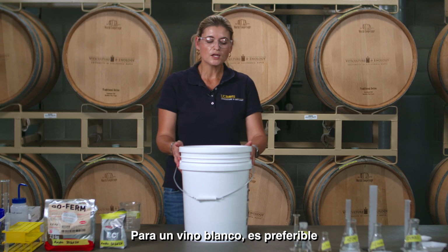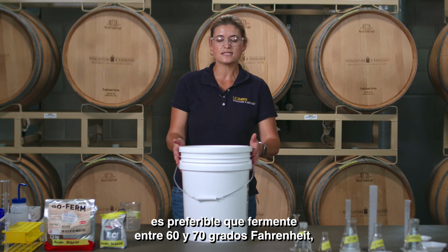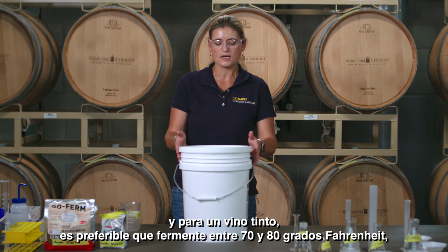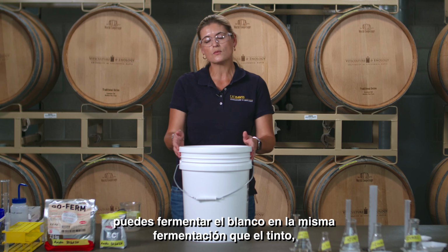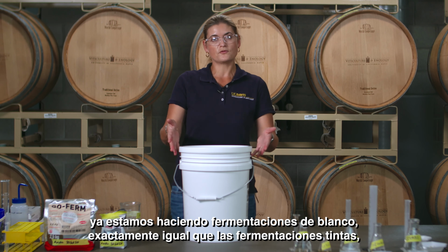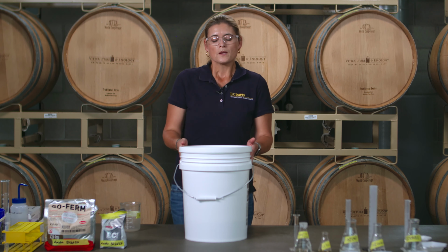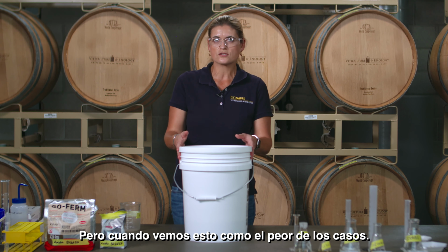For a white wine, you want preferentially to ferment at 60 to 70 degrees Fahrenheit, and for a red wine you want to ferment again at between 70 to 80 degrees Fahrenheit. If you do not have a cool area, you can ferment the white at the same fermentation as the red. We're already doing white fermentations exactly like red fermentations by fermenting them in contact with skins and seeds, which is a little bit more severe for the whites, but we see this as worst case scenario.